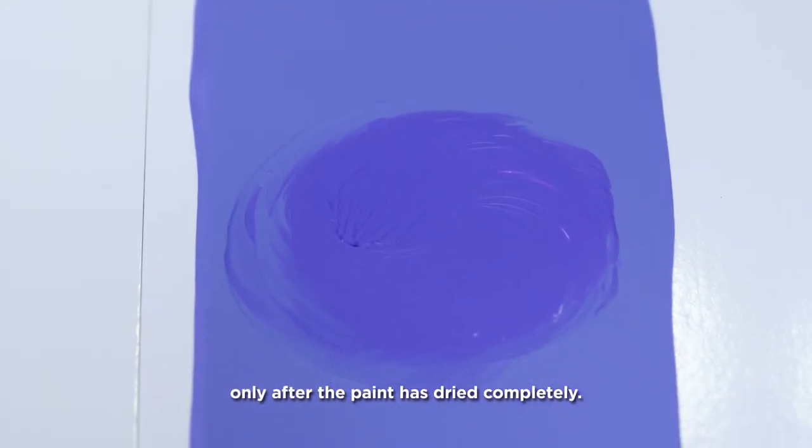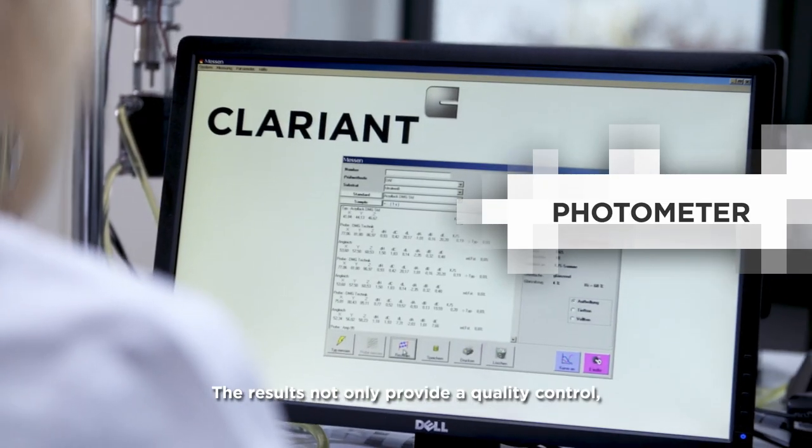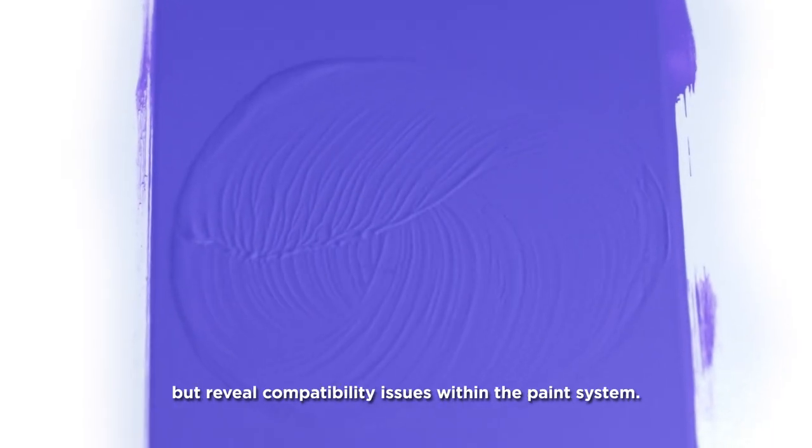Whether it was a good or bad formulation can be determined only after the paint has dried completely. The results not only provide quality control, but reveal compatibility issues within the paint system.